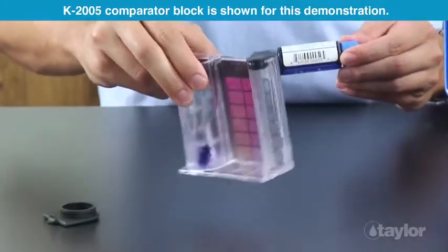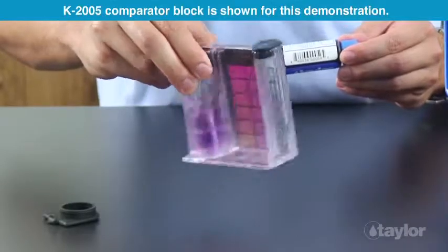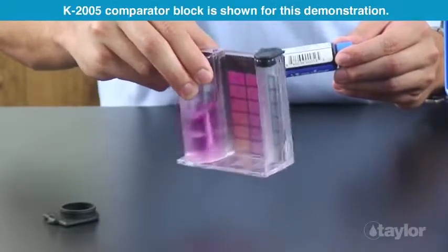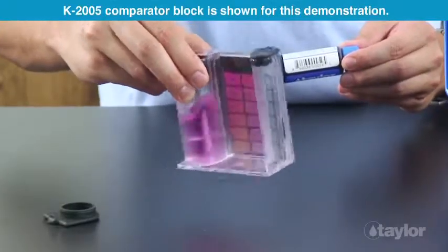Swirl to mix. If calcium hardness is present, the sample will turn red.